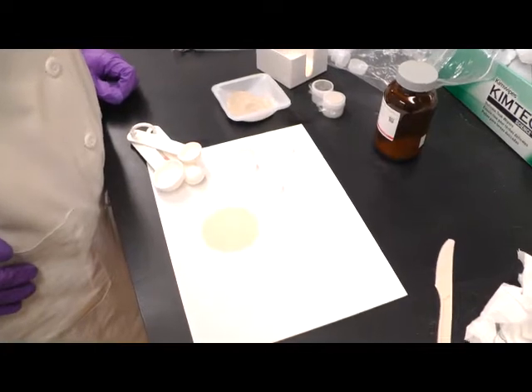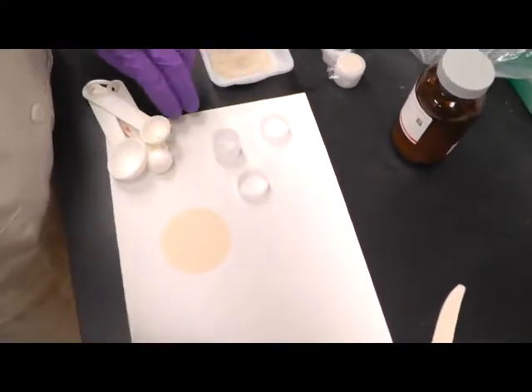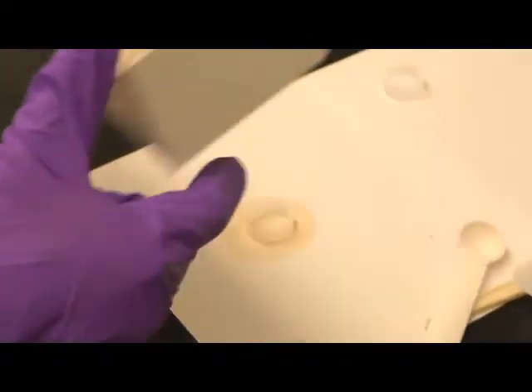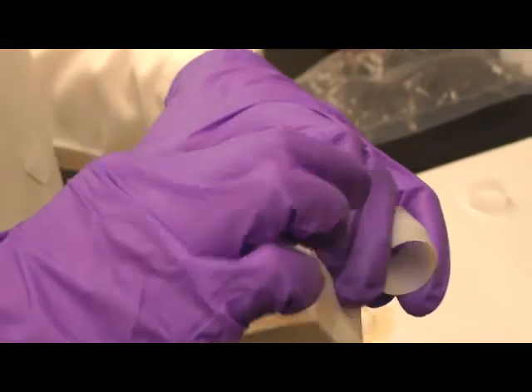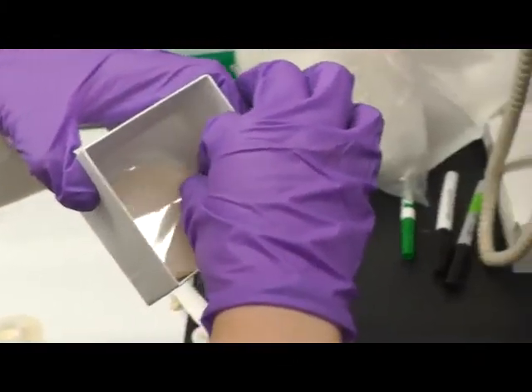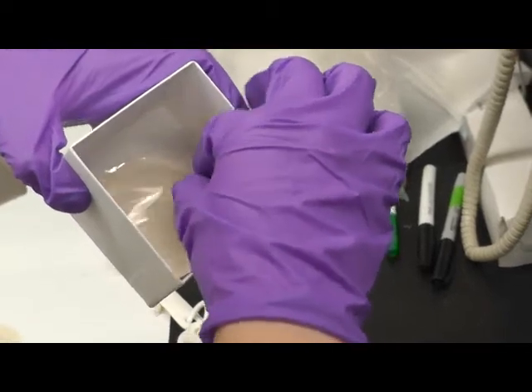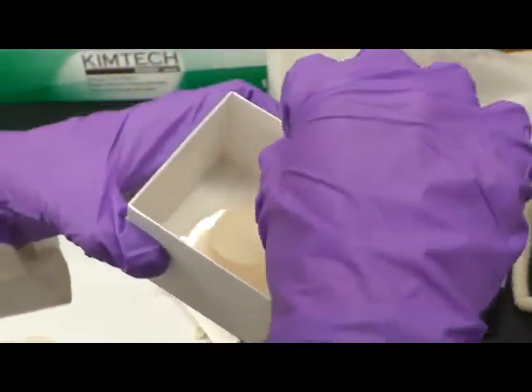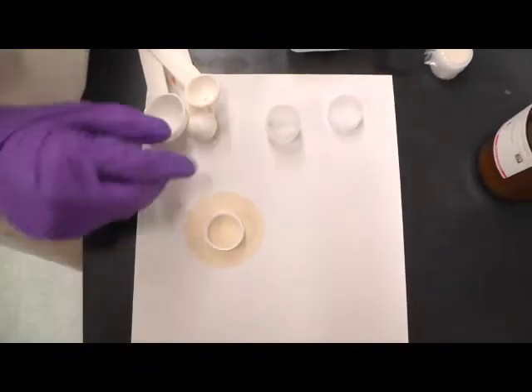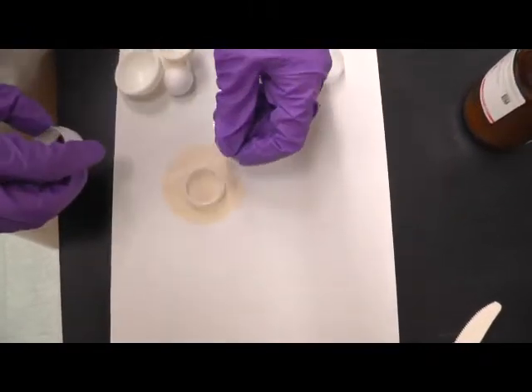So what you need to do is actually find a clean place for the XRF to be placed on. And you get one thin film. It's okay to use fingers, but try to grab the edge of the thin film. Do not touch the central part.